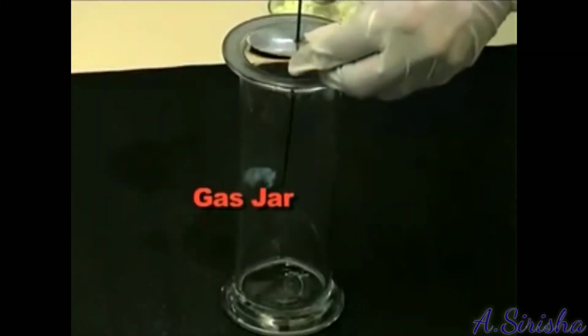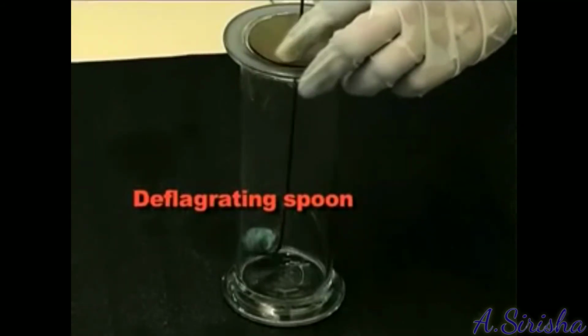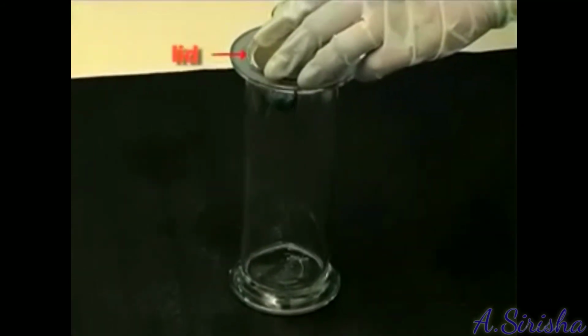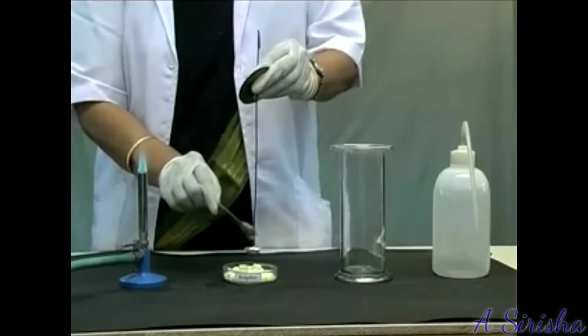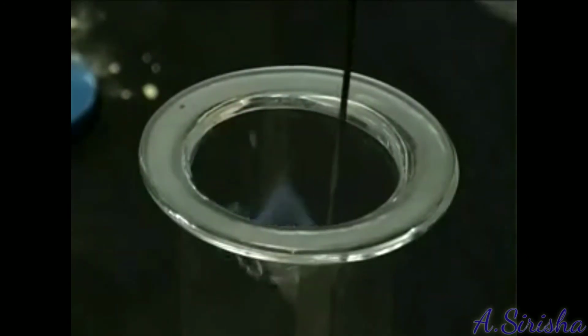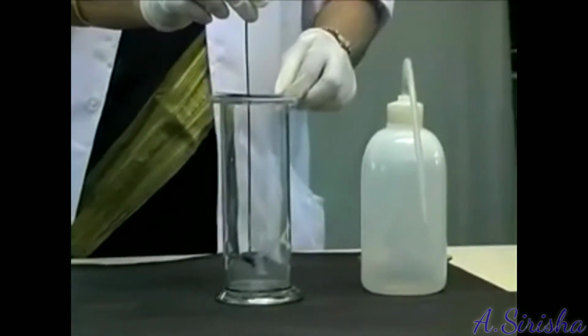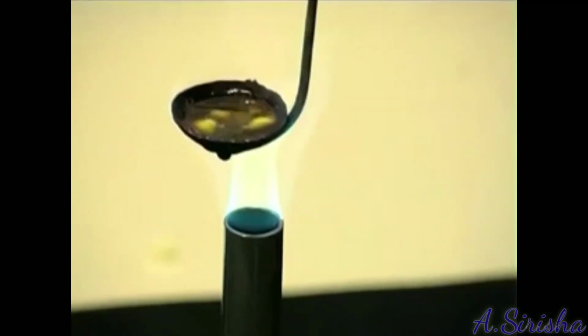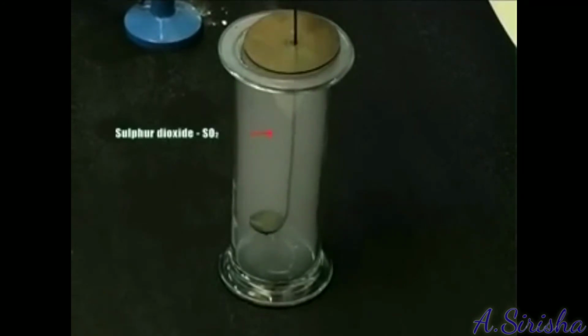Materials required: glass jar, deflagrating spoon, spirit lamp, and sulphur. Take a small quantity of powdered sulphur in a deflagrating spoon and heat it on a spirit lamp. As soon as sulphur starts burning, introduce the spoon into the glass jar or tumbler. Cover the tumbler with a lid to ensure that the gas produced does not escape. Remove the spoon after some time, but try to keep the jar covered.